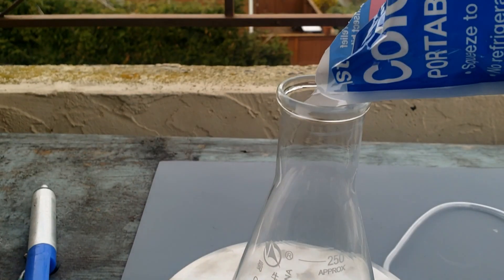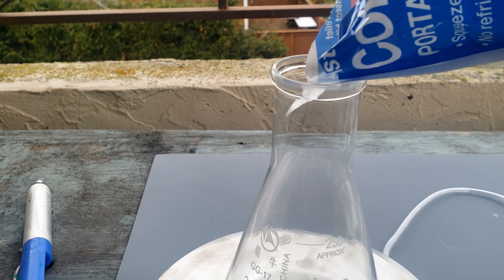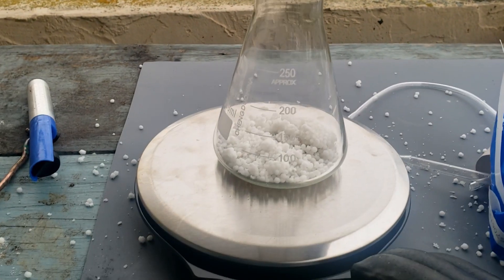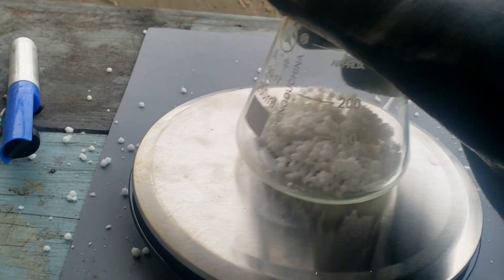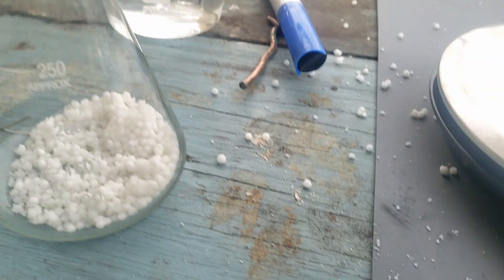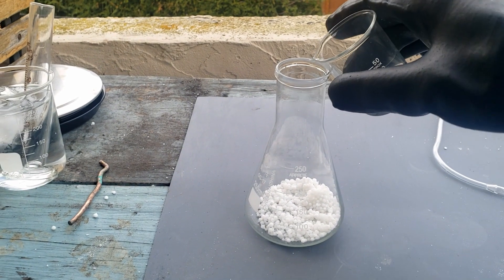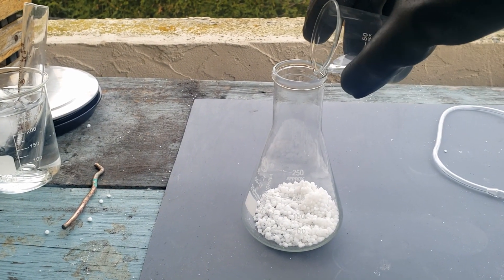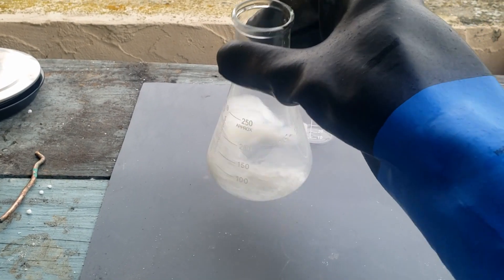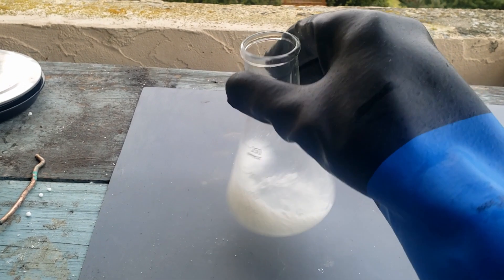I start off by measuring out 80 grams of nitrate salt. Here I am using ammonium nitrate found from some instant cold packs that clearly state they use ammonium nitrate and not urea. I then add about 15 milliliters of water, and if you are using cold packs like I am, make sure to filter off all the anti-caking agent.